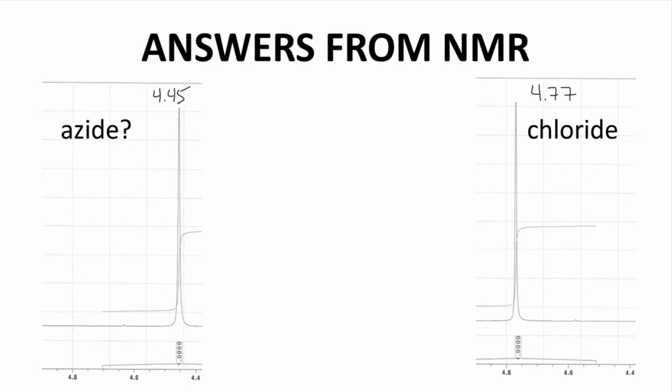Still, it would be nice to have even more evidence that these are different peaks. The values of 4.45 and 4.77 are not very different. Chemical shifts in NMR can drift, although a drift of 0.3 ppm would be very surprising. Regardless, how can we be more certain? Just like with TLC and the mixed melting point experiment, we can mix both the product and starting material together in the same NMR tube and run a combined NMR spectrum.